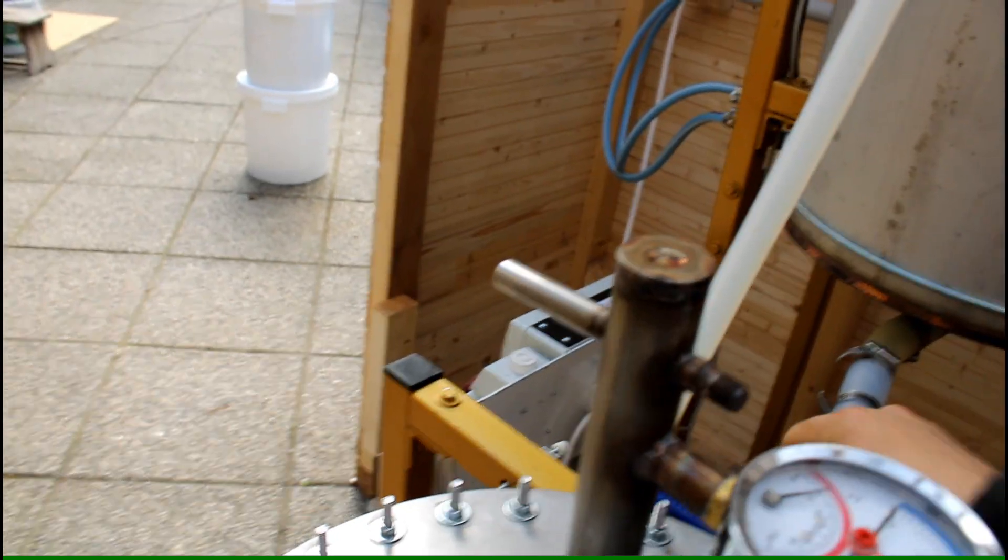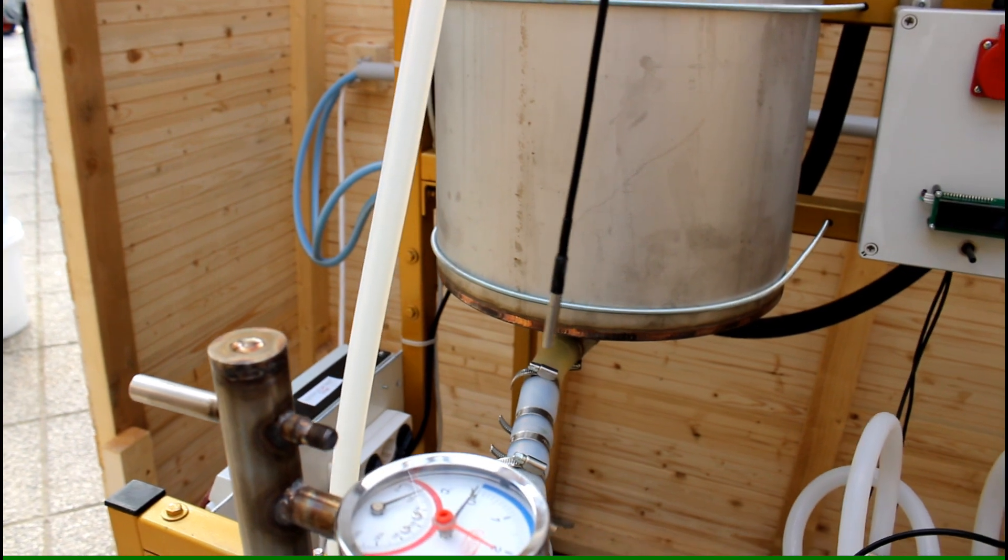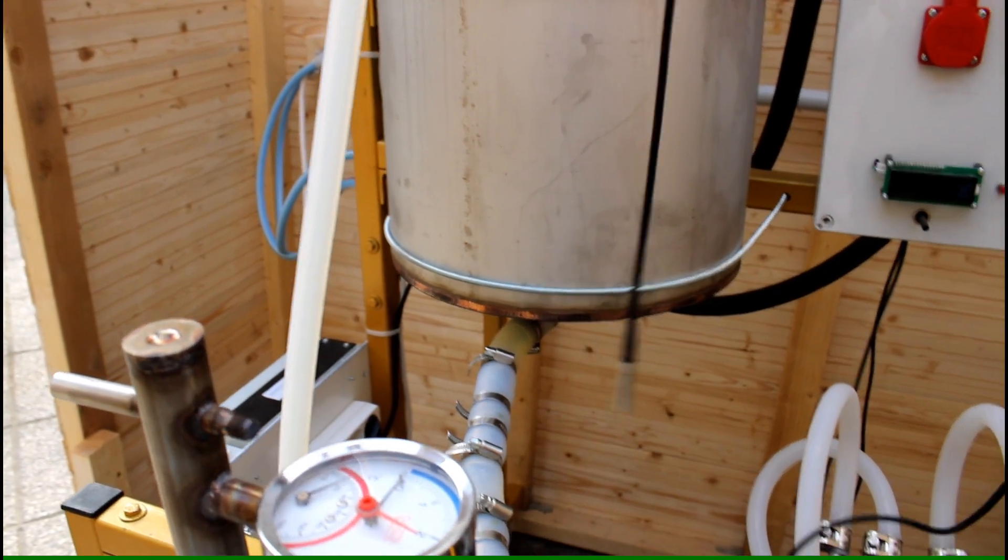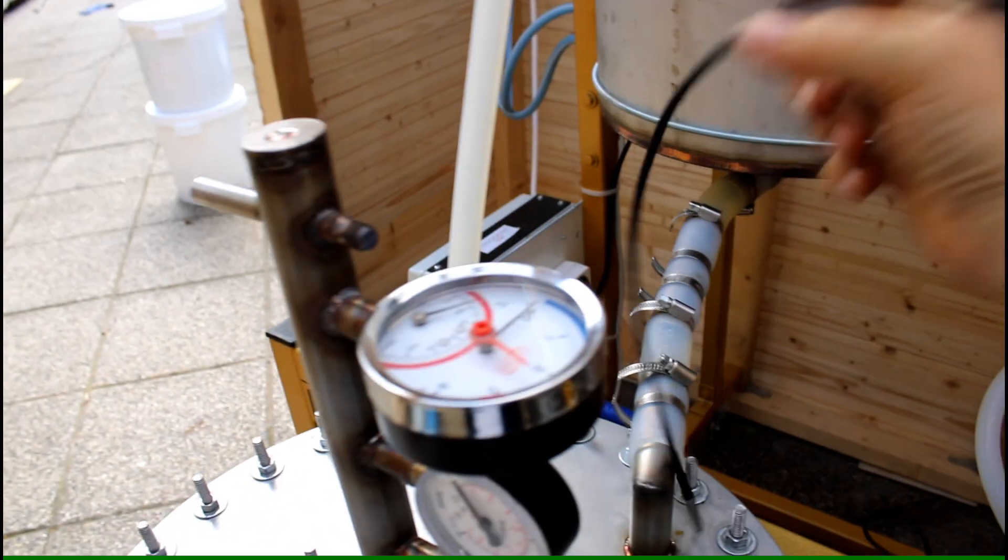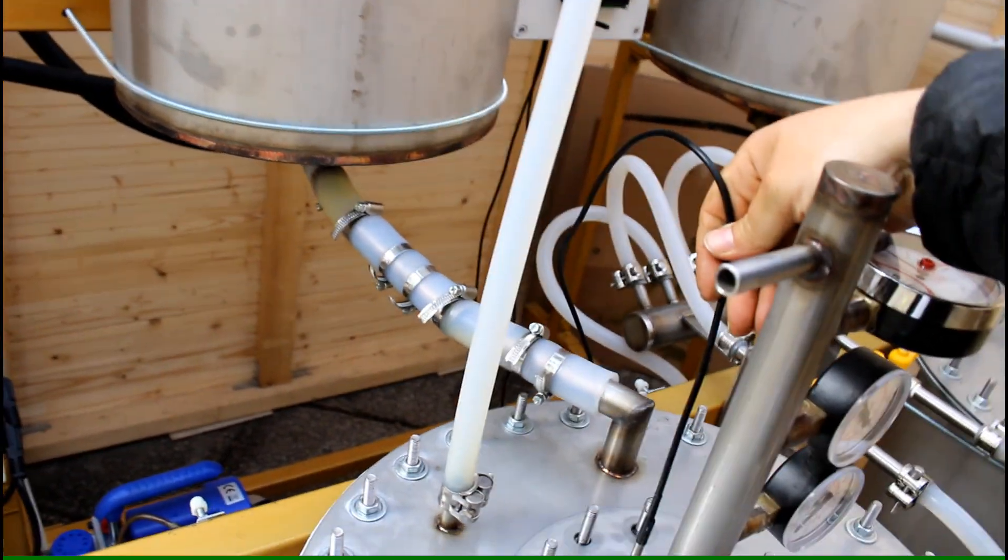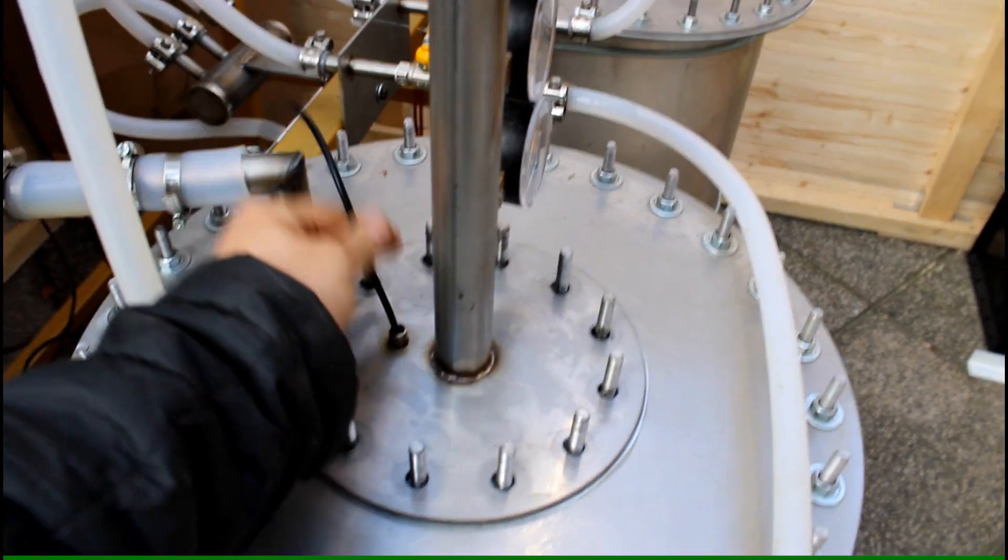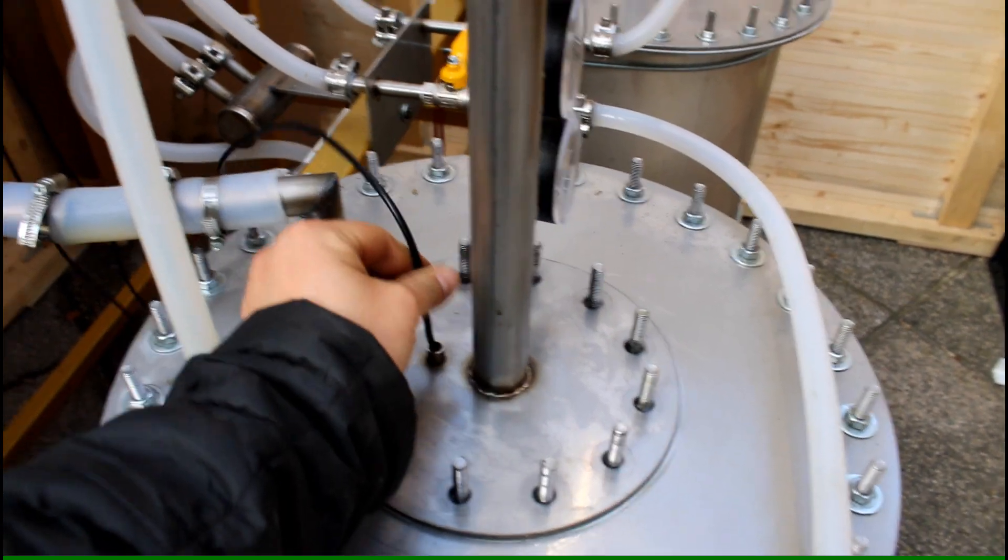These are the actual temperature probes here. I measure the temperature with an Arduino. So this temperature probe is simply put into this hole here. Just completely insert it and that's it.